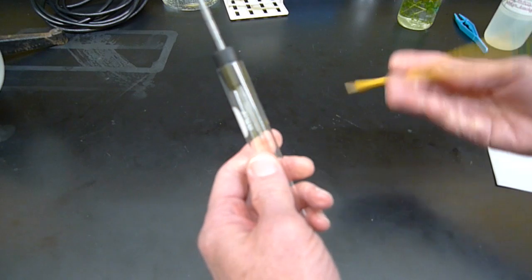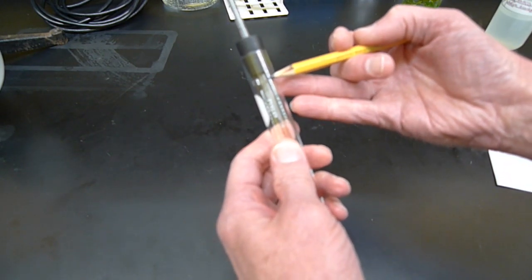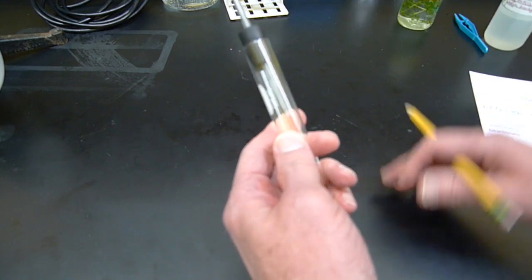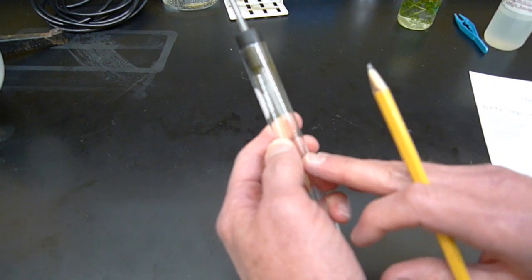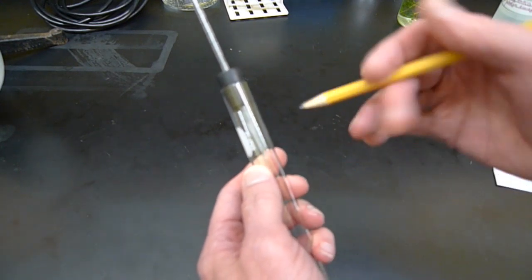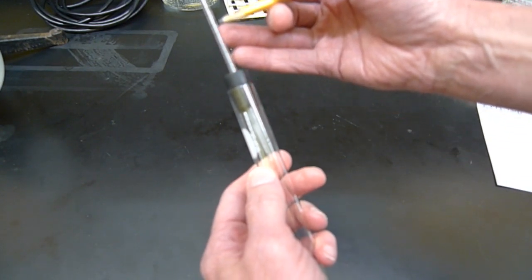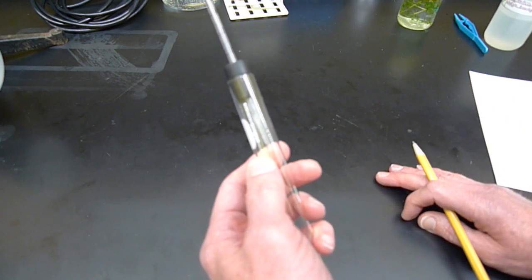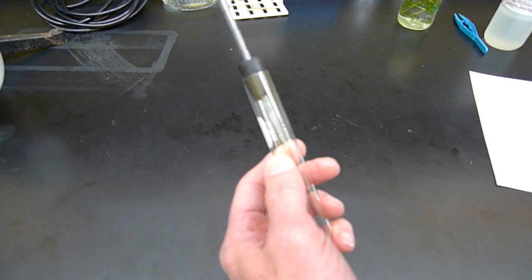So this is going to be filled up almost to the top, little gap of air in the tube here, and then it's going to be sealed up. As oxygen is produced from the Elodea inside the tube here, it's going to produce more gas pressure up here. The gas pressure is going to push liquid up into the tube. That's how we're going to measure the progress of photosynthesis here.